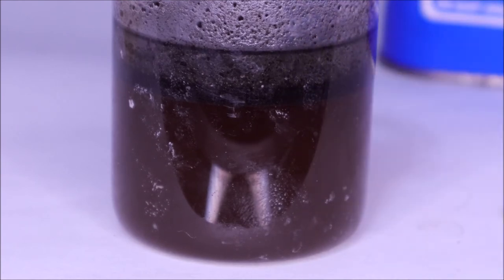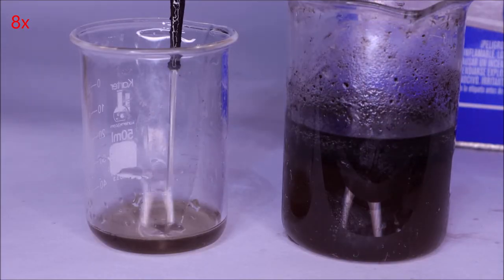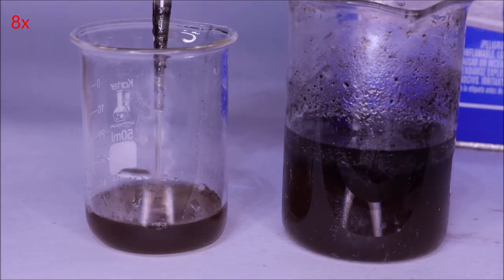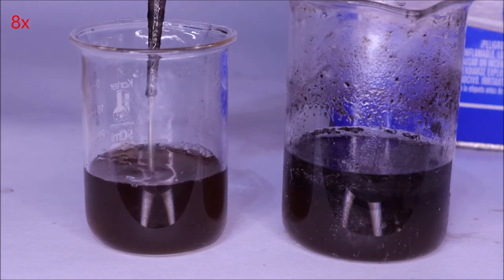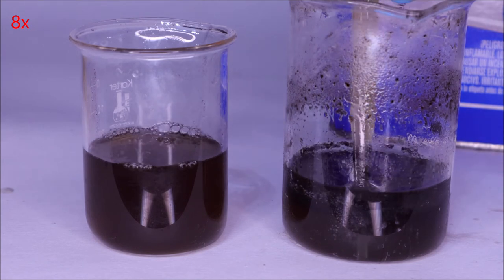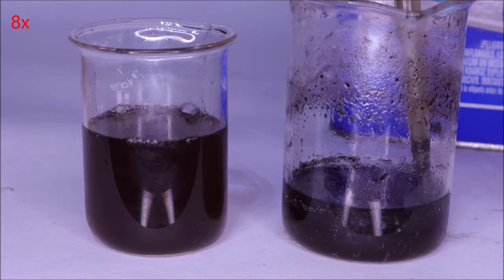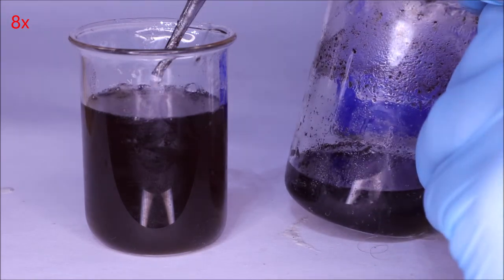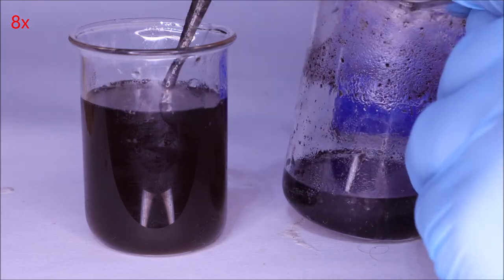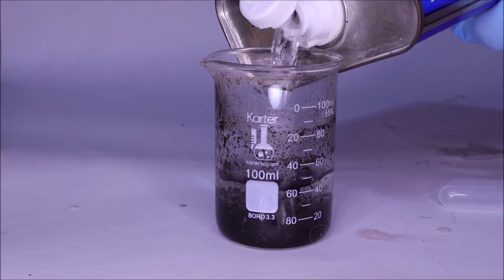The principle was that these were two distinct layers and they both had different attractiveness to acetone. My thought process was that one of them could very well be isolated amino acids that had fixed its own problem. I first took that top layer and I tried dissolving it in more acetone to see if I could get anything to precipitate. Well, it really didn't.